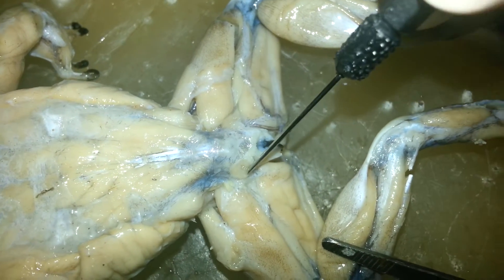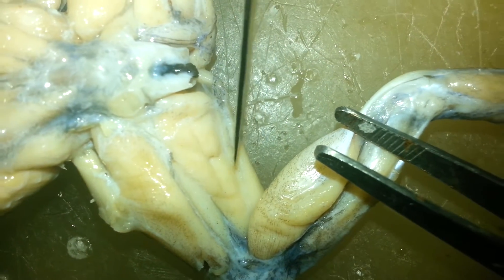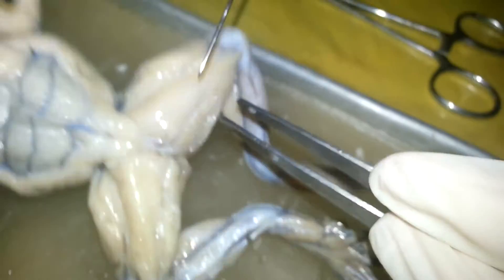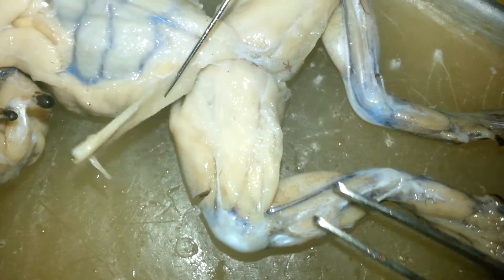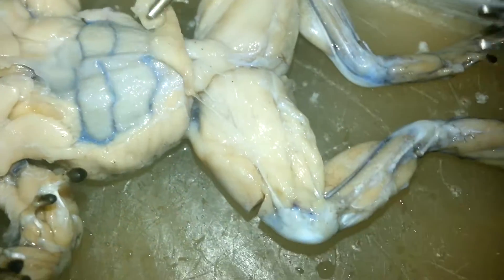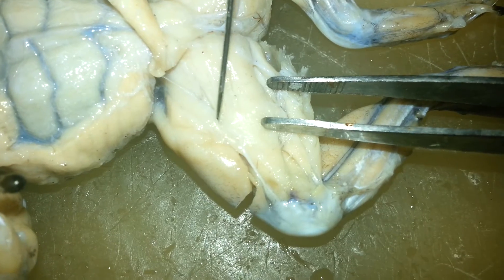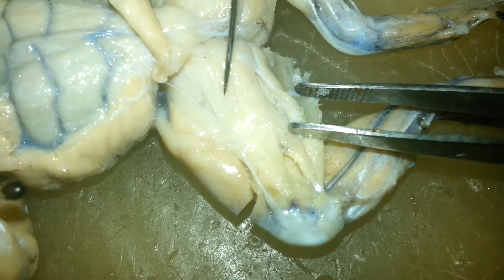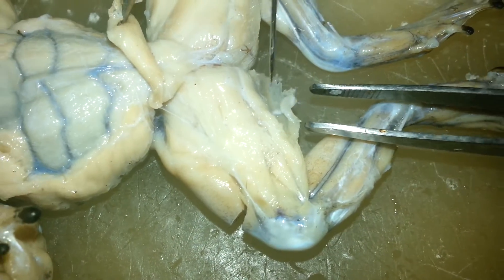It's like the piriformis — piriformis — and then the semimembranosus. You can tell it by the obliques. Semimembranosus, sartorius — change to the ventral side. Beneath the sartorius is the adductor longus.